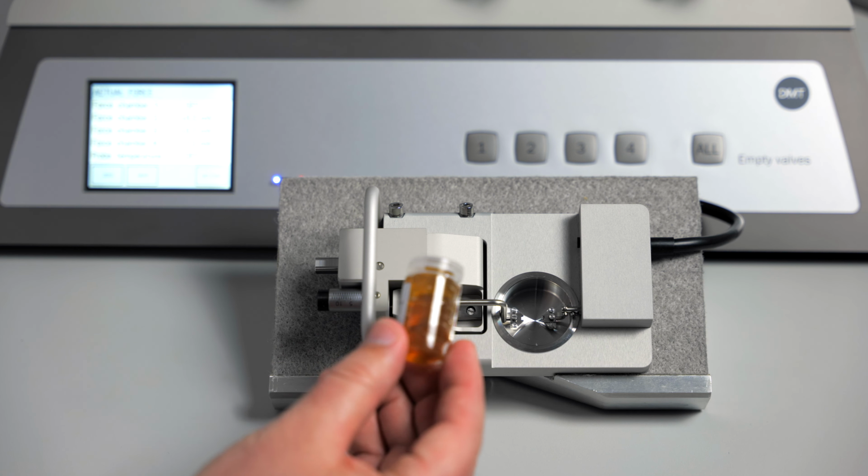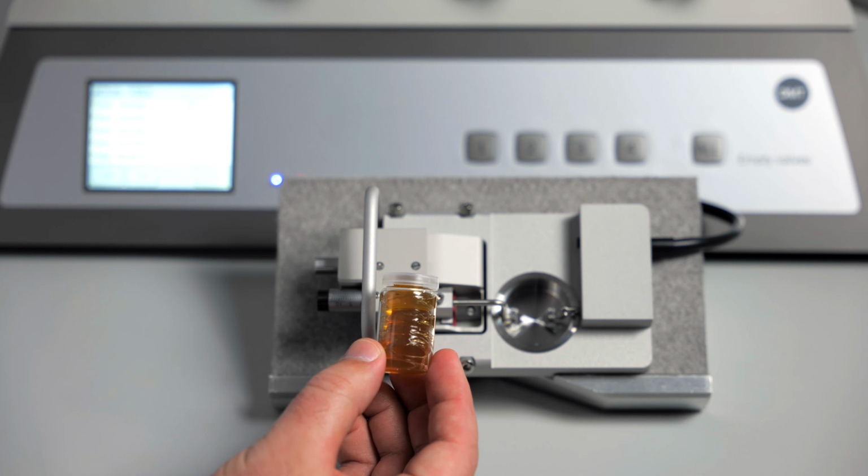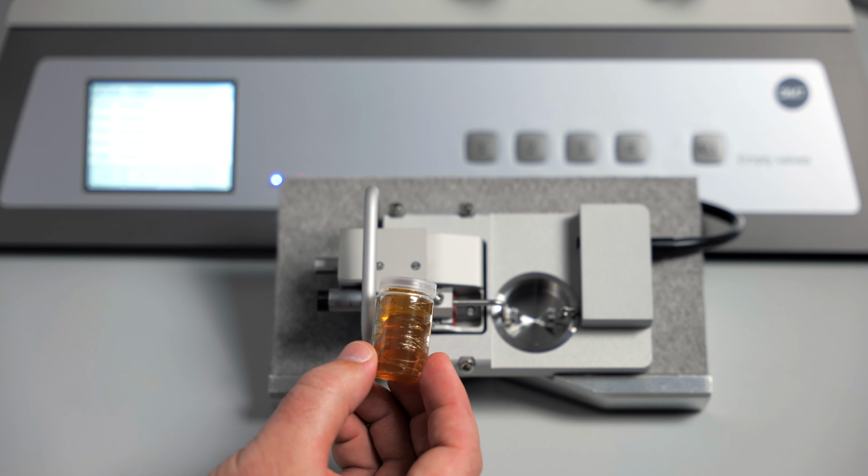You will use the brown petroleum-based grease. This will affect the function of your tissue if it gets in the tissue chamber itself. Be careful not to get this in the chamber.